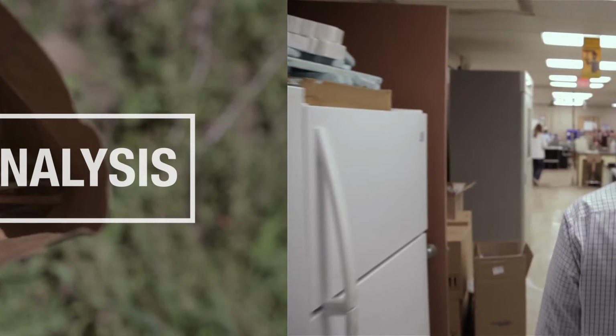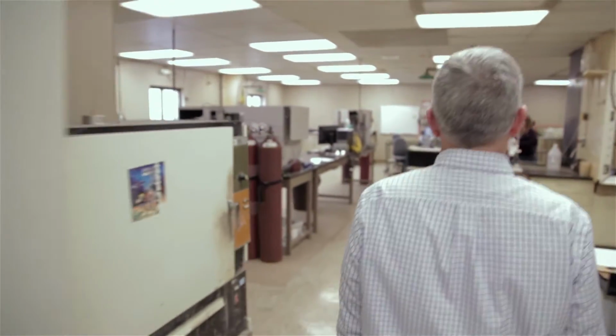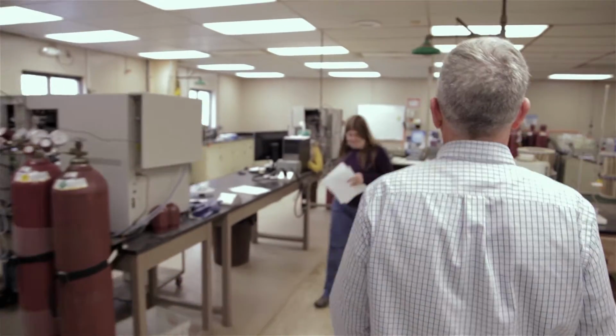Welcome to Dairy One. Dairy One is a farmer-owned cooperative providing management and analytical services to agriculture in the northeastern United States. One of our services is called plant tissue analysis. Plant tissue analysis is used to determine nutrient deficiencies or excesses in plants themselves.